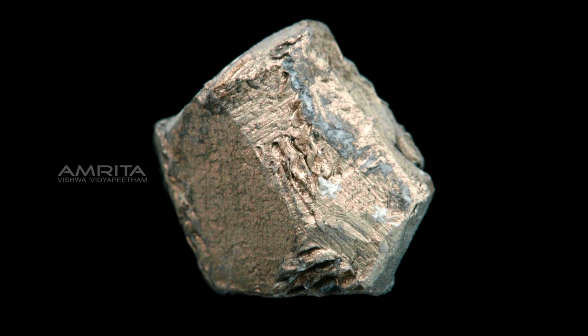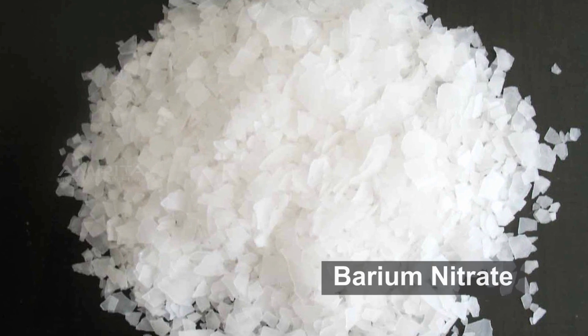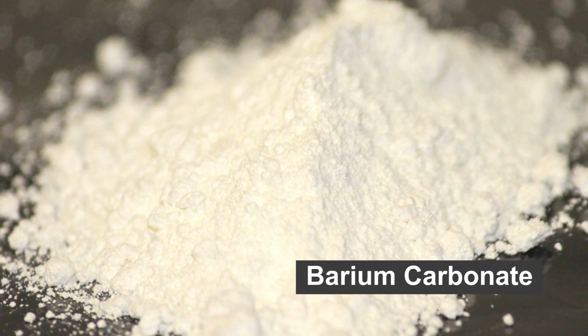Tests for barium ion. Barium is a chemical element with symbol Ba. It is found in various salts like barium nitrate, barium sulphate and barium carbonate as barium 2 positive ion.